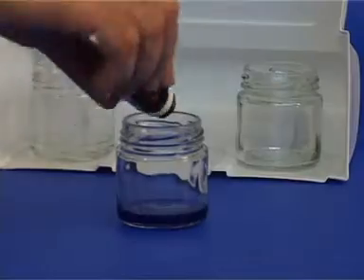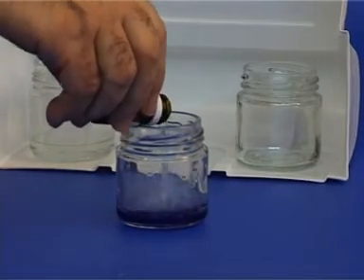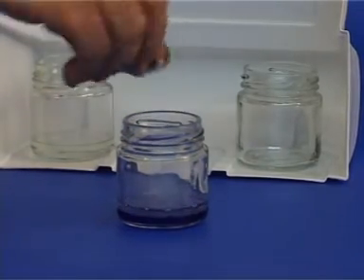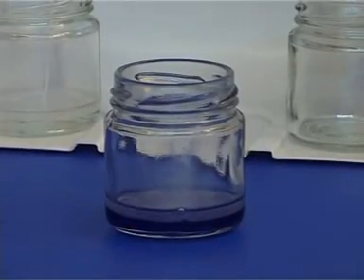Repeat the whole process, this time with another pair of solutions. However, now use a colored hexamethylenediamine solution so that it is easier to see the interface between the two solutions.